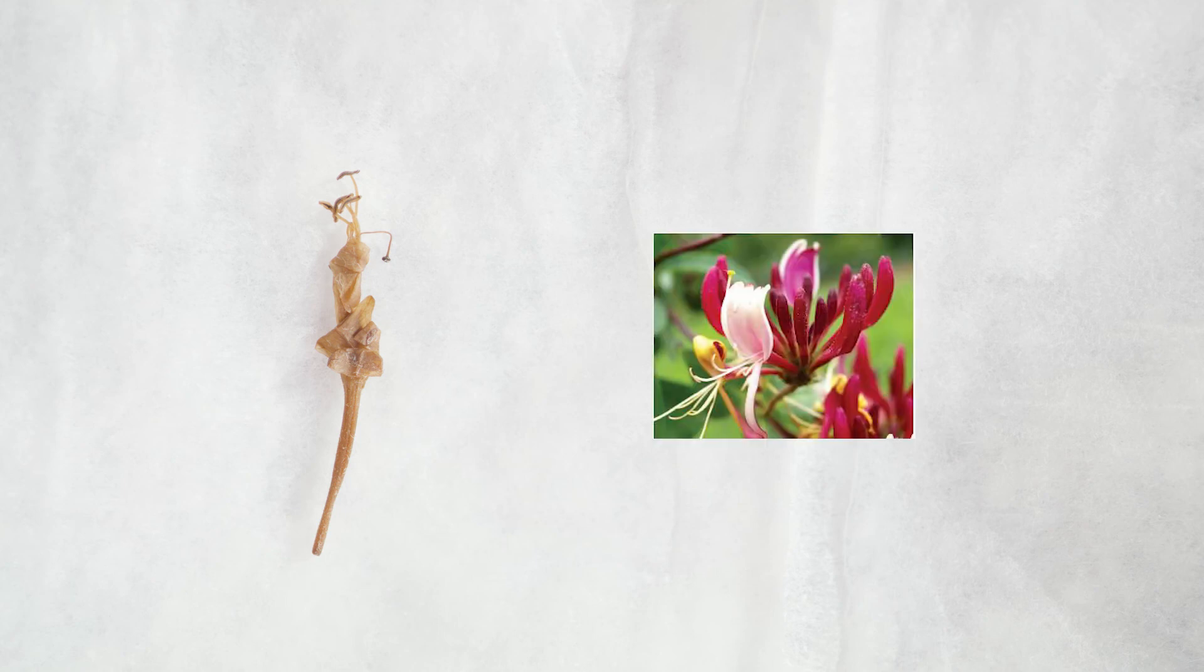Preserved flowers do not retain all the color or structural integrity of fresh flowers. This may make it difficult to identify a structure. As you work, compare your specimens to the images of their living counterparts in the lab manual to help you identify the required structures to complete the investigation.